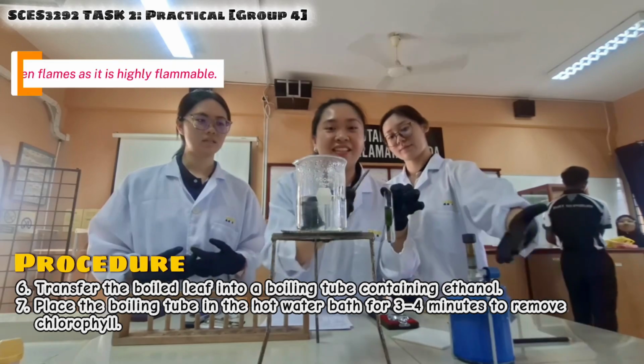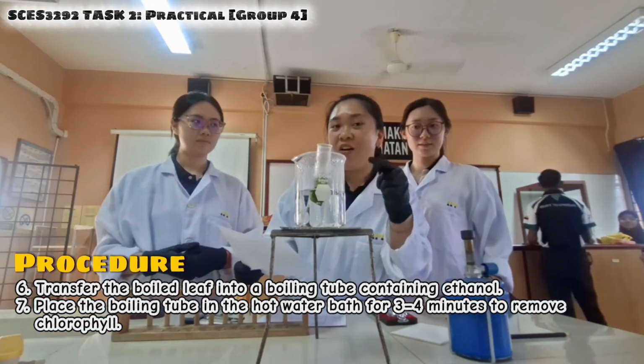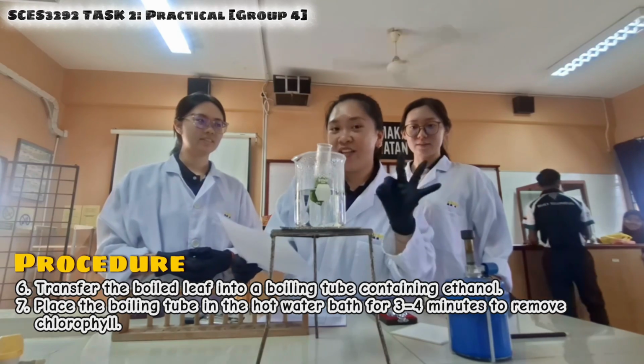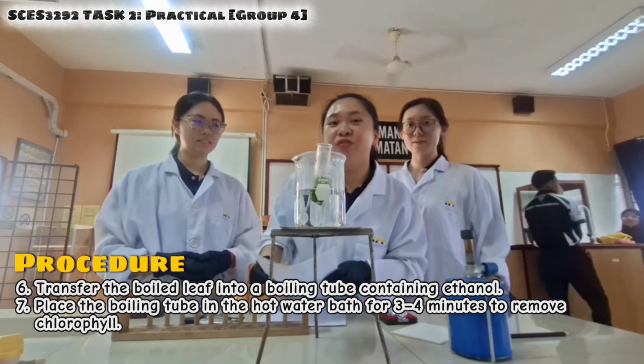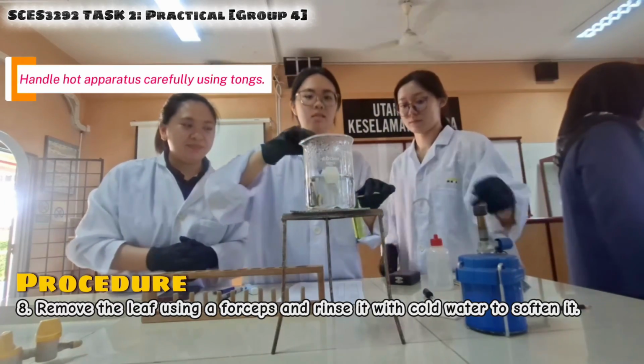The Bunsen burner is removed and then place the boiling tube into the hot water bath for 3 to 4 minutes to remove chlorophyll. I'm going to take out the leaf and rinse with distilled water.